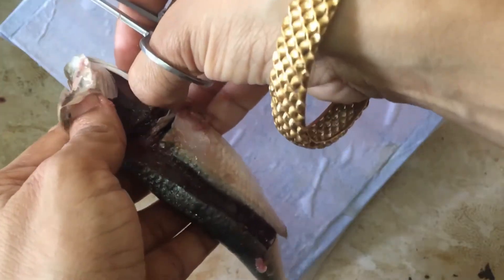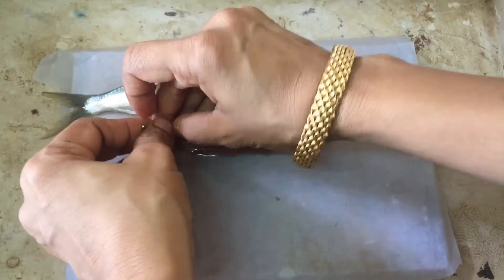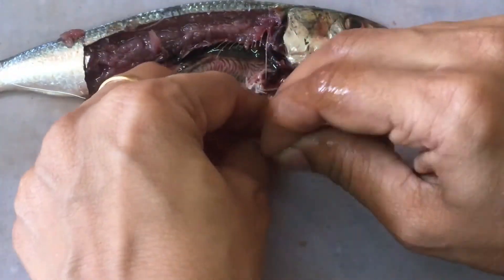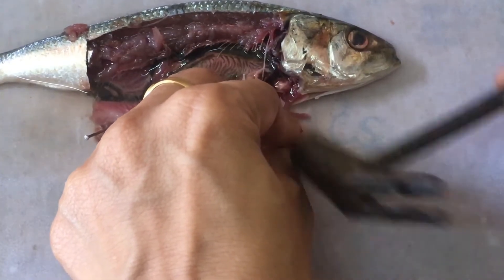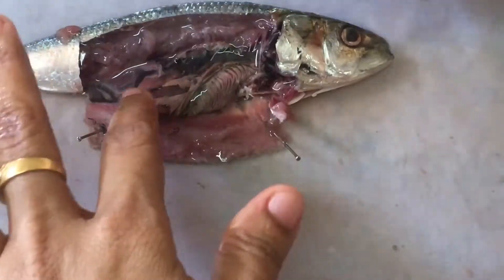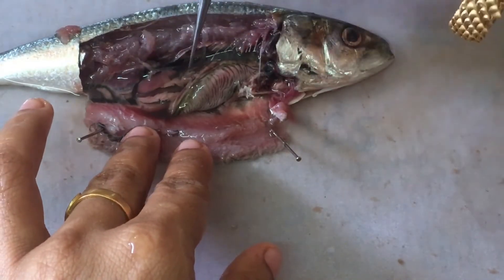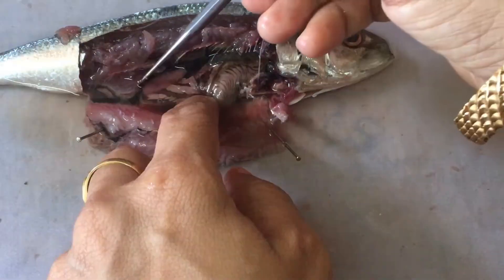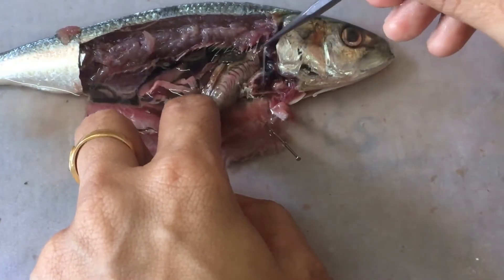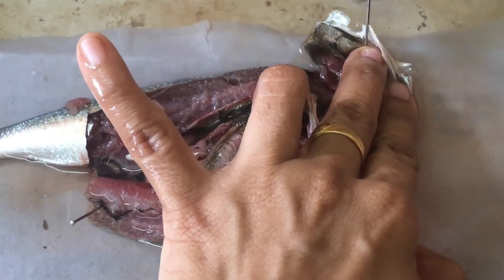It's almost done. Now it's time for us to fix the fish over the board. While fixing it, we should keep the fish towards the top of the board — only then can we spread the alimentary canal properly down the board without it hanging off. It should have enough space to spread. Also, flushing water over the intestine is an important method that will help you to uncoil the intestine without breaking it.